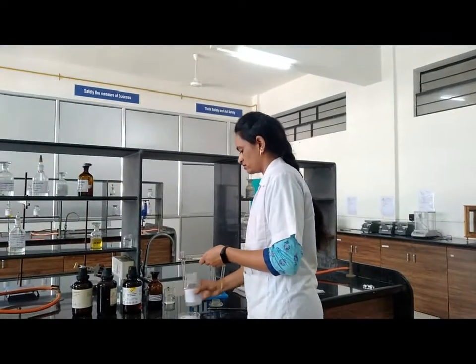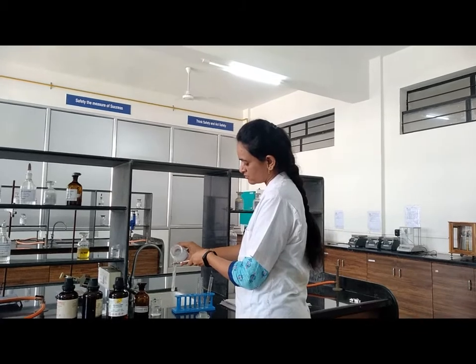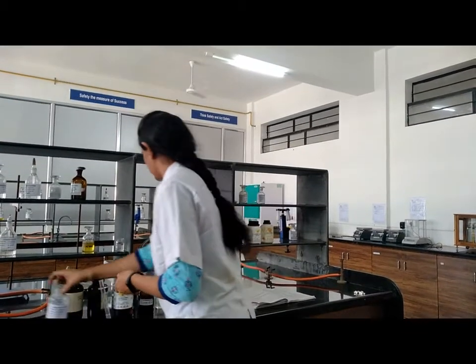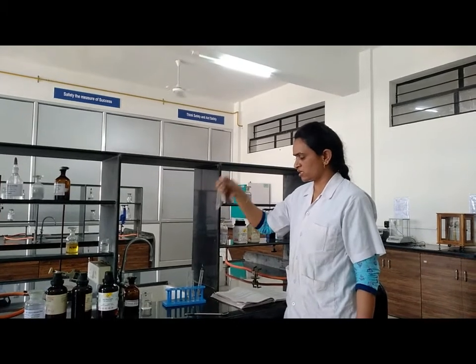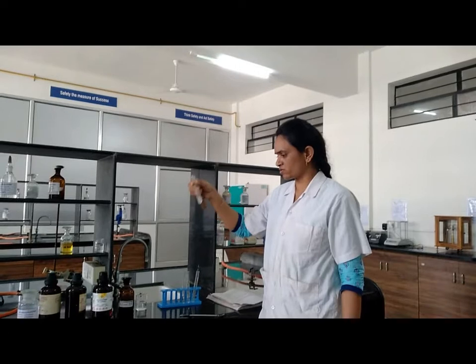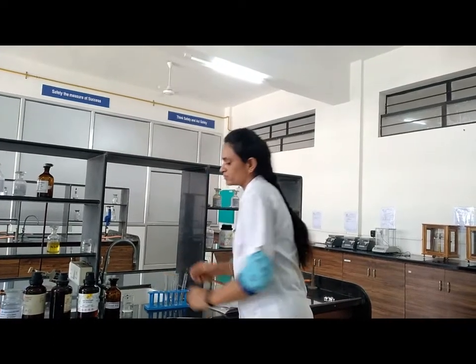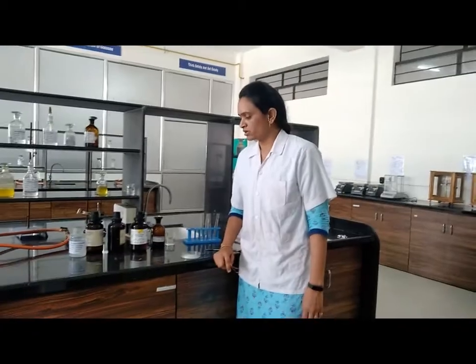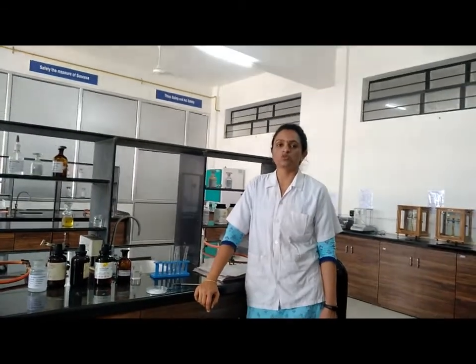Next, we check solubility in diethyl ether and then in alkali hydroxide solution, that is sodium hydroxide solution. All solubility tests are performed to check the solubility of Sulfamethoxazole in different solvents: water, alcohol, chloroform, acetone, diethyl ether, and alkali sodium hydroxide solution.